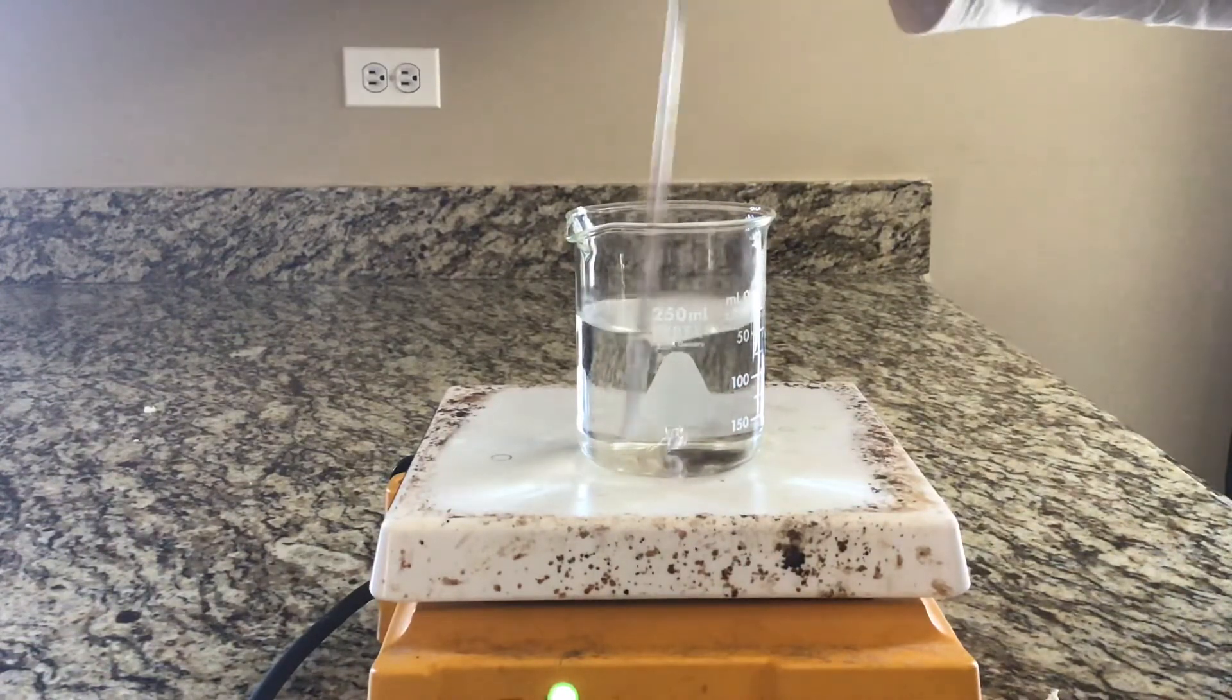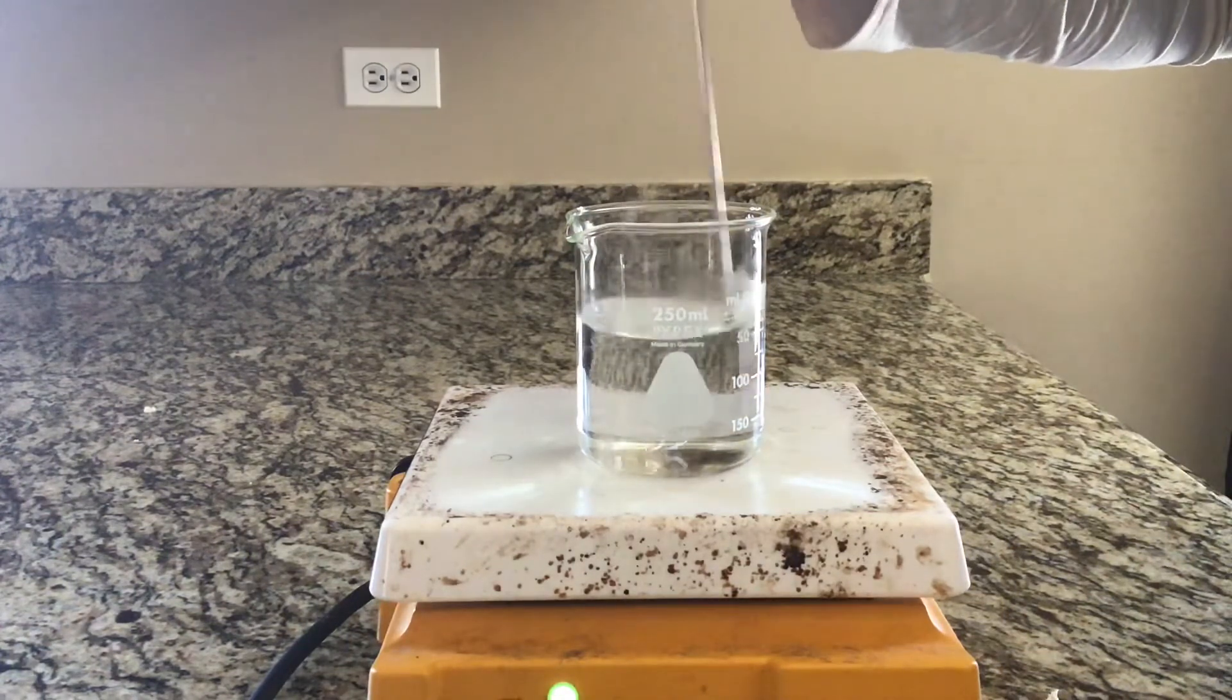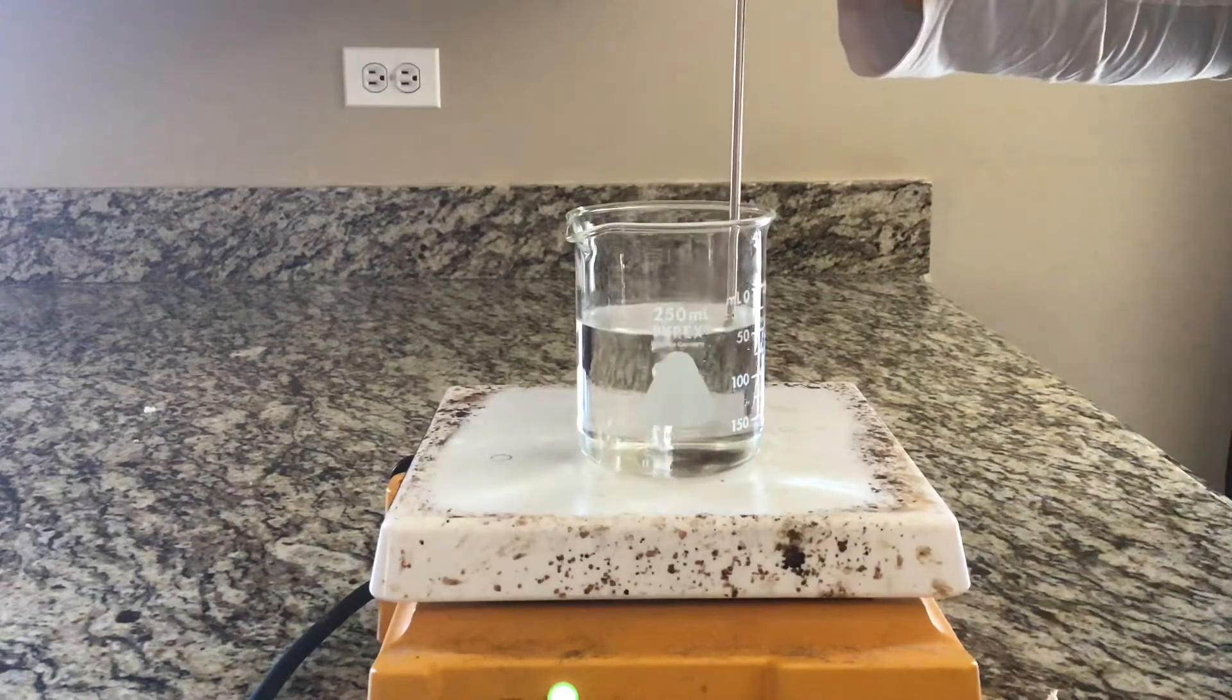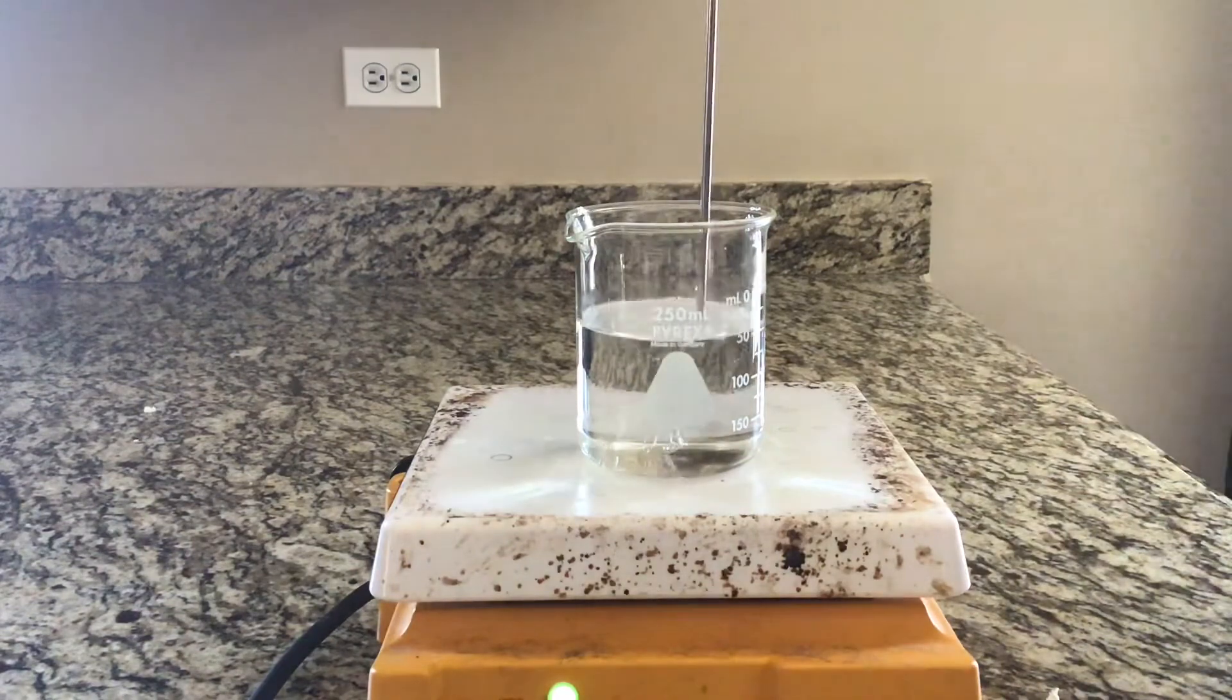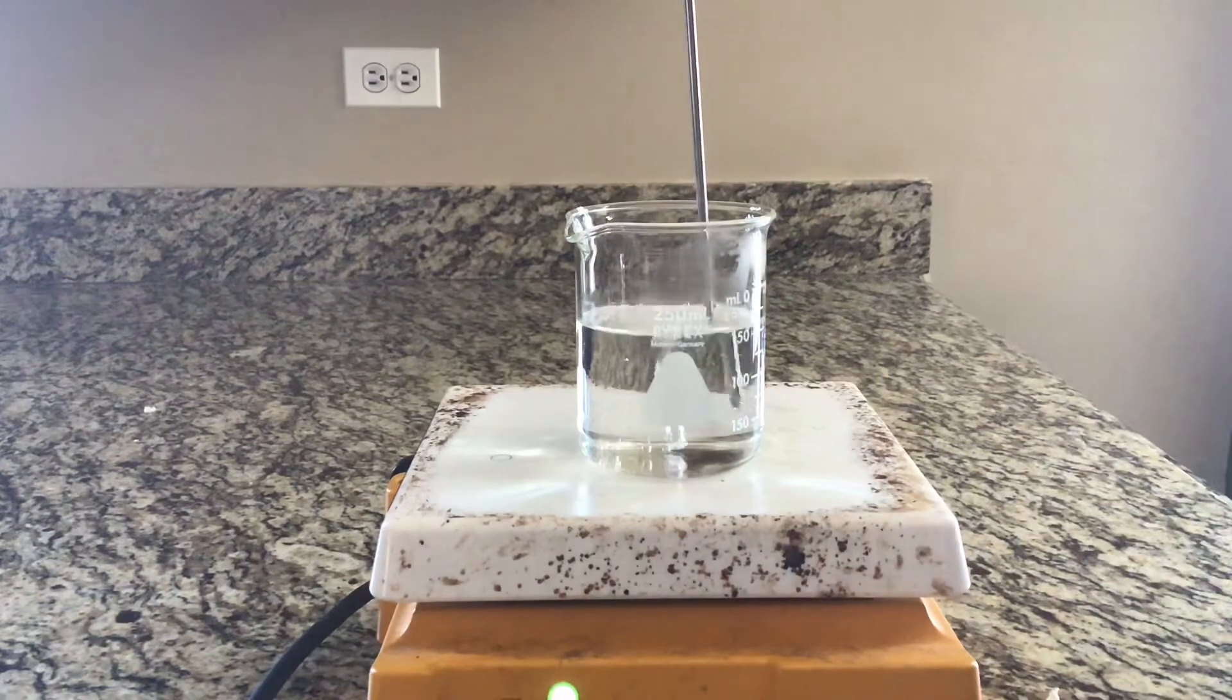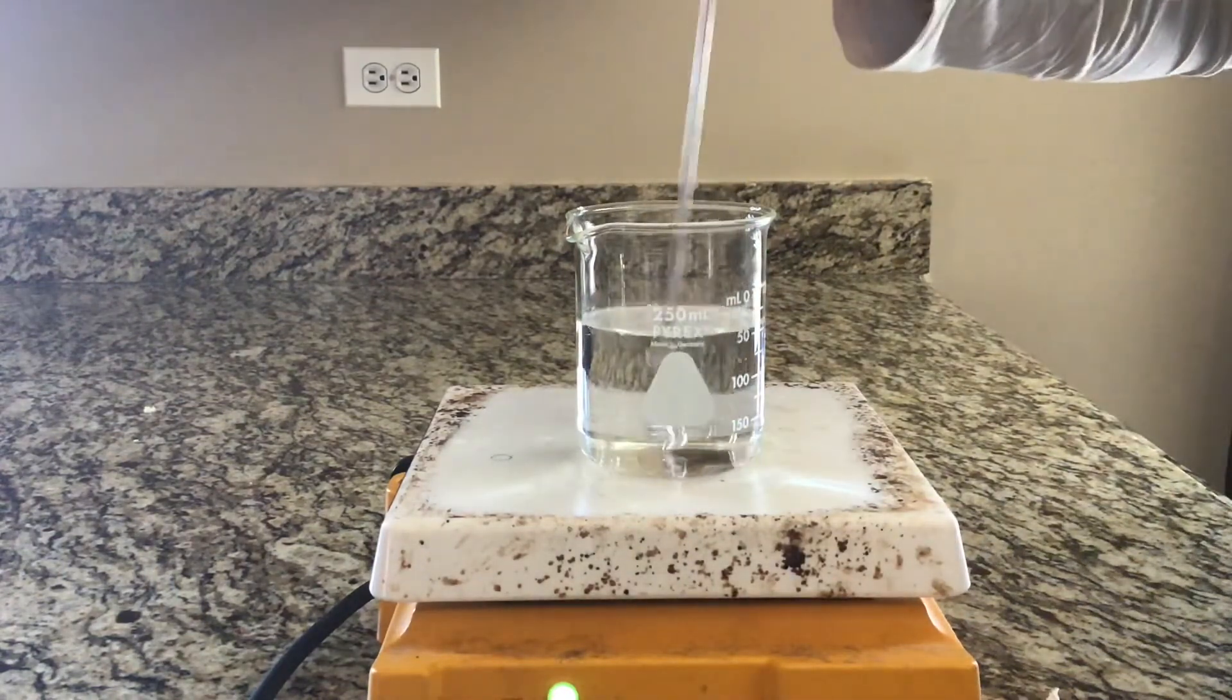Coming up on 13 minutes here. You can do the math for how many seconds that is, but 13 minutes is 96.5 degrees Celsius. As you can see, slight little bubbles are starting to form but it's not quite boiling yet.